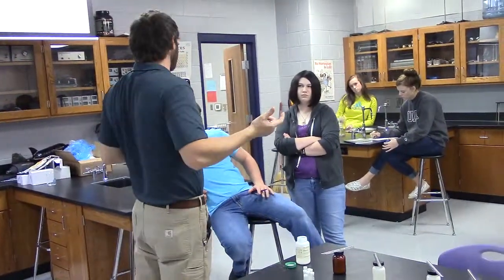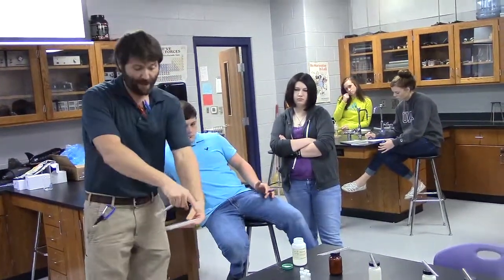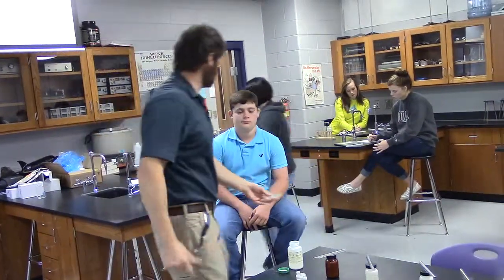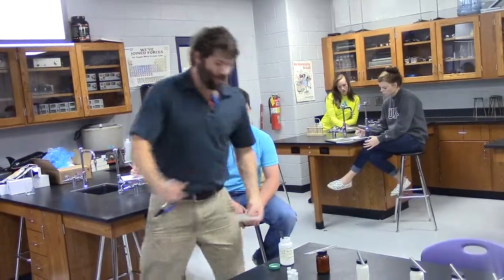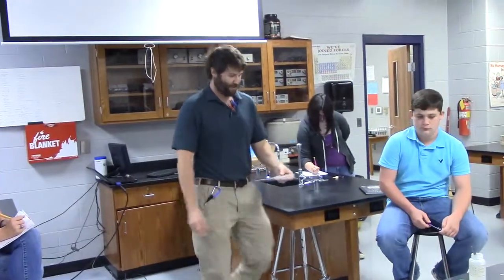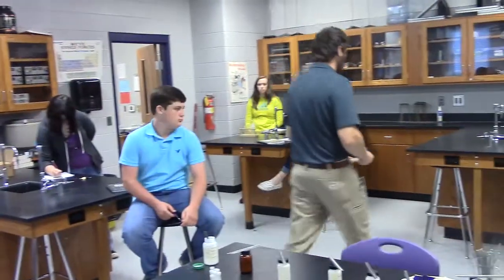Matter of fact, in your procedures, if you drew a little picture of a spot plate and just wrote out what you put in each little one, that would actually work great in procedures. Do some of that. Now, one of you will do this, at which point you're going to lose a letter grade tomorrow because you're going to go over here and you're going to get something and you're going to walk away.